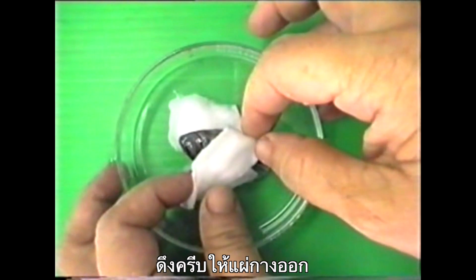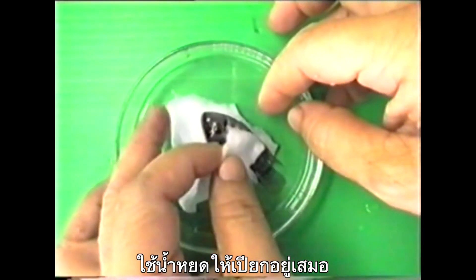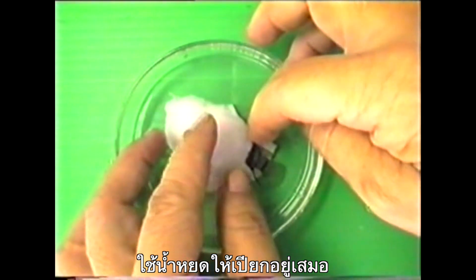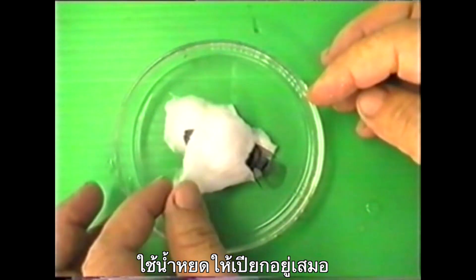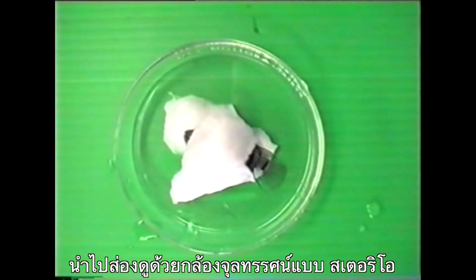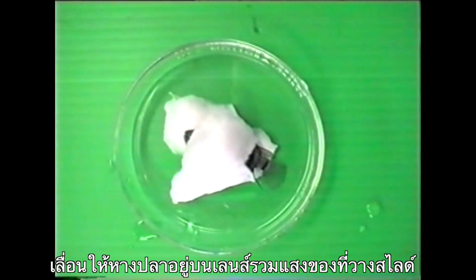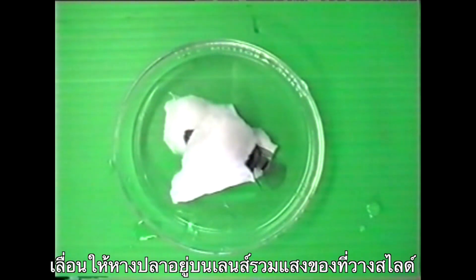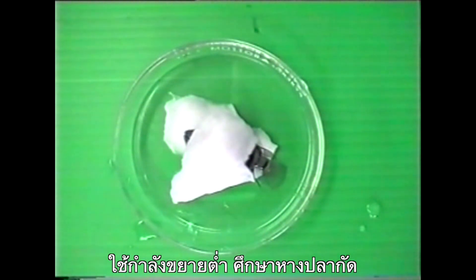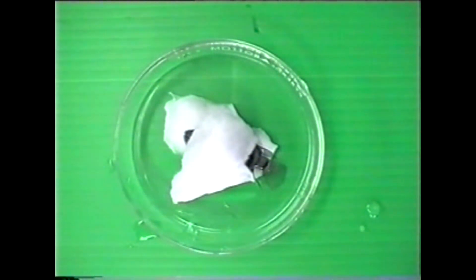Its tail should lie flat on the Petri dish. You may apply some more water to the cotton and tail to keep the fish wet. Place the Petri dish on the stage of a microscope so that the fish's tail is over the stage opening. Use a low magnification to observe the fish's tail.